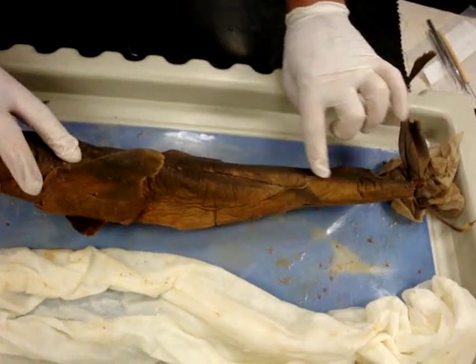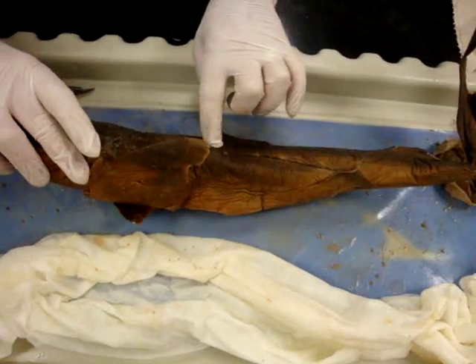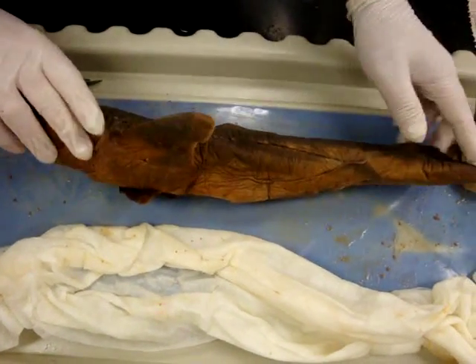Here we have what's called the lateral line. It disappears right here, but you'll have to trust me — it's there. It's sensitive to water currents.